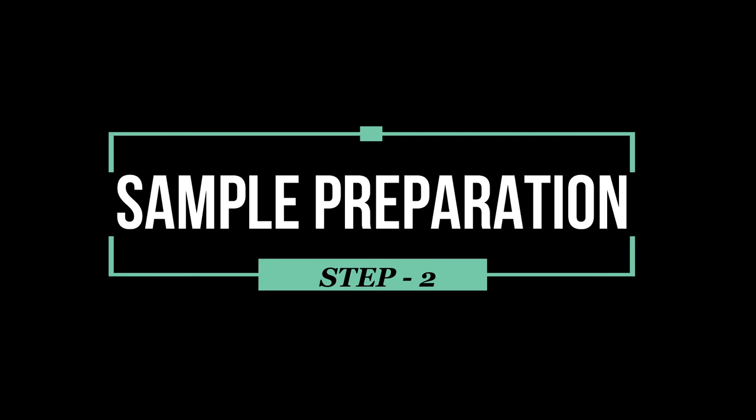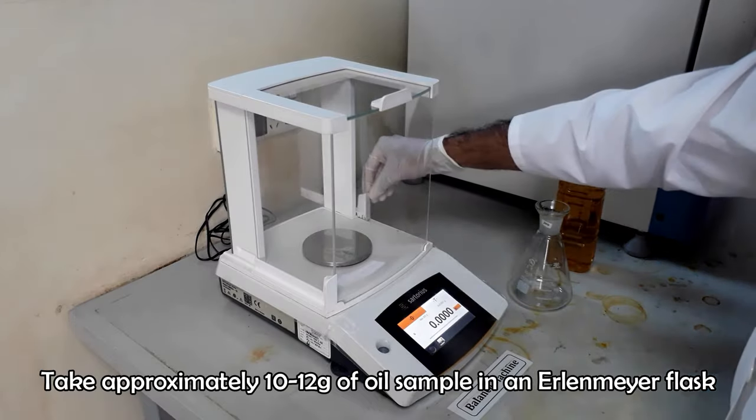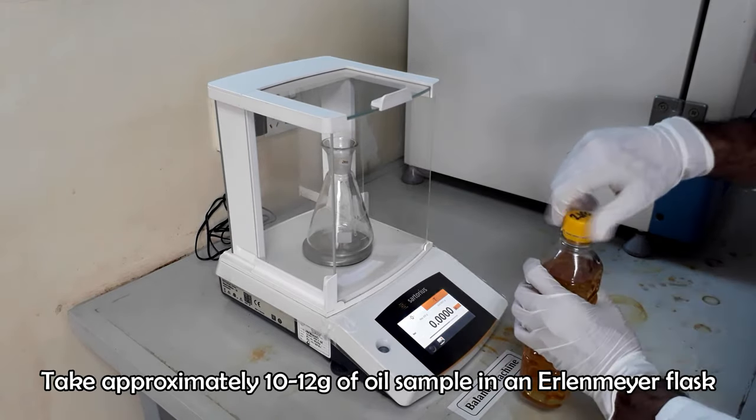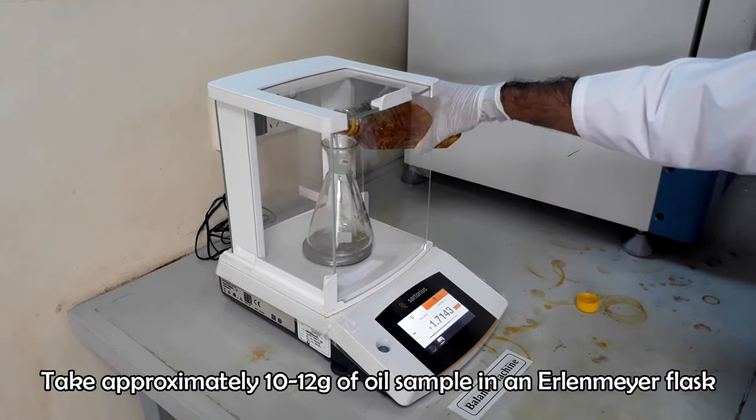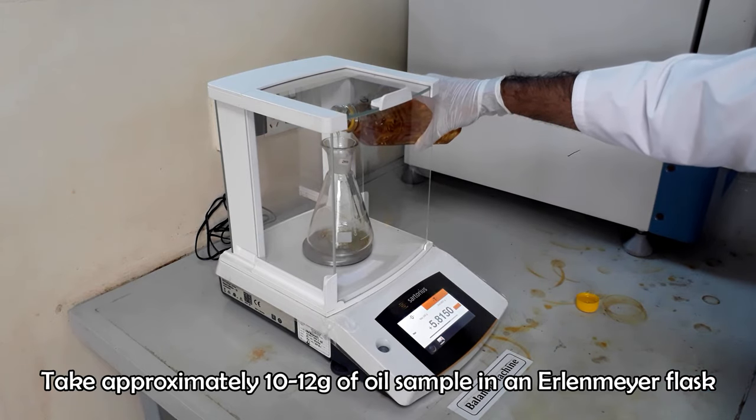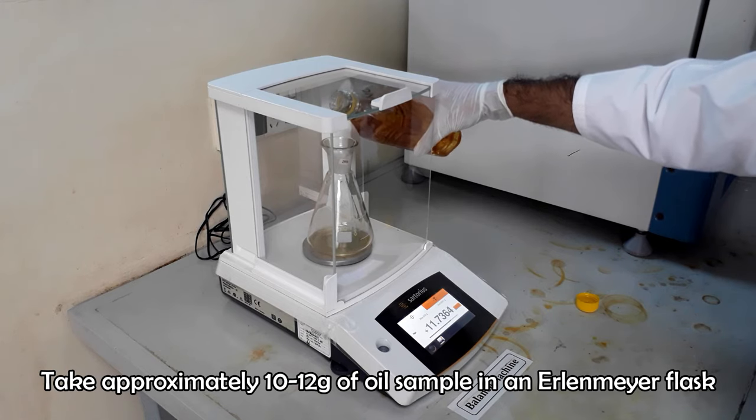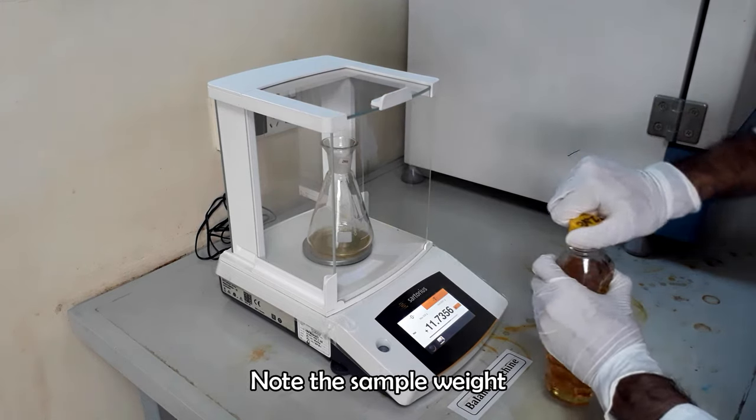Now, we have to prepare our sample. Take 10-12 g of oil sample in an Erlenmeyer flask. Note the sample weight.